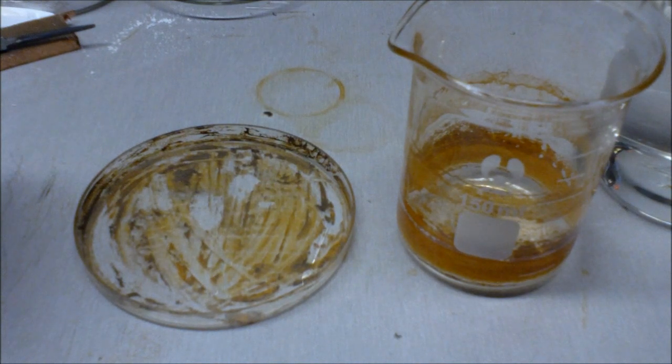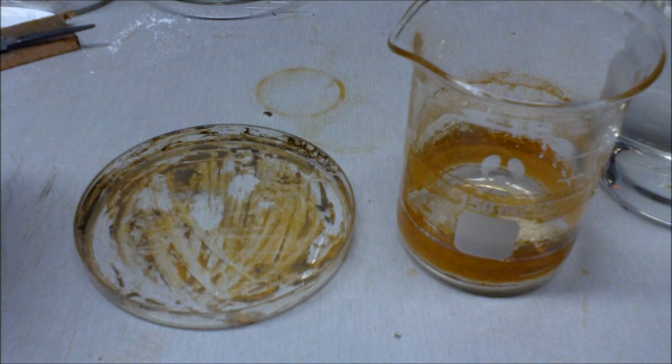Hello. Today I'm going to show you how to remove rust stains from glassware using oxalic acid.